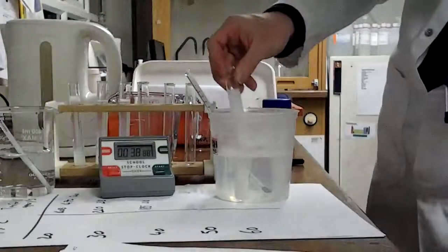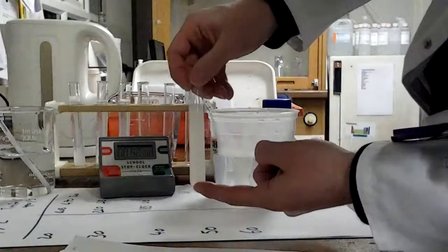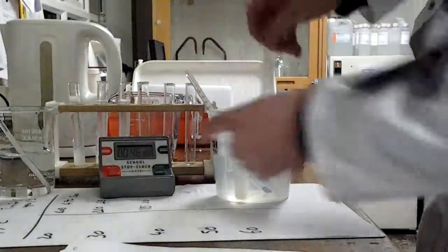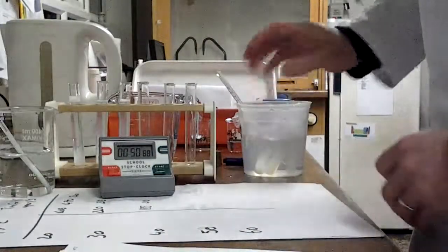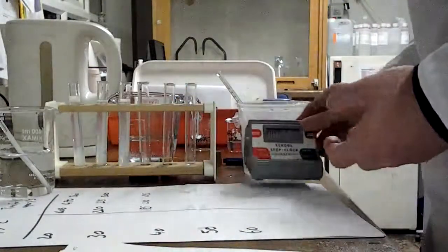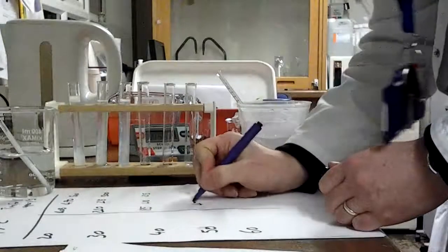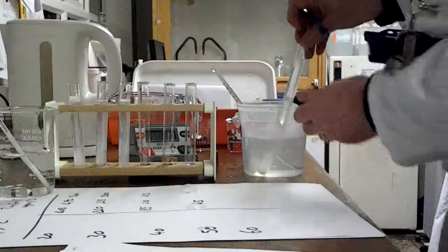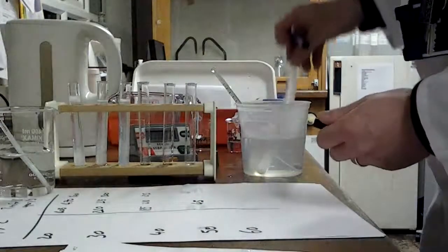This one's been going barely 30 seconds. I hope you can see that it's already starting to look a little bit clearer. I can now see the X through that, so that's about 45 seconds at 50 degrees. So that one has, as we might have expected, broken it down much, much quicker. Okay, so 45 seconds on that tube there. In fact, I can now see this one's really broken down. You can see that that one is completely clear now.